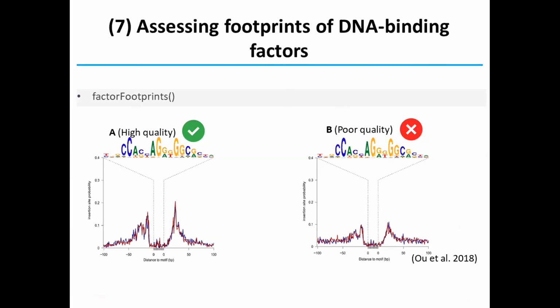So the transcription factor binding to the open chromatin region can interfere with the Tn5 transposition process, which leaves some footprint. Especially for the actively bound transcription factor, such as CTCF, we can use the factor footprints to visualize the footprint. For high quality ATAC-seq data, you should see a deep valley of the footprint. It's pretty deep, a deep footprint. But for poor quality ATAC-seq data, the footprint may be very shallow or even barely seeable.